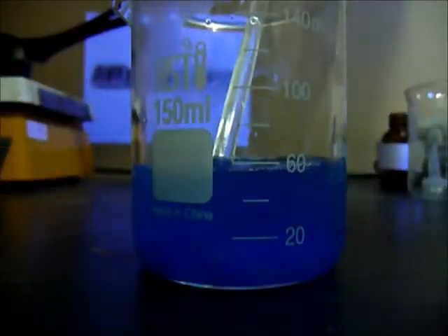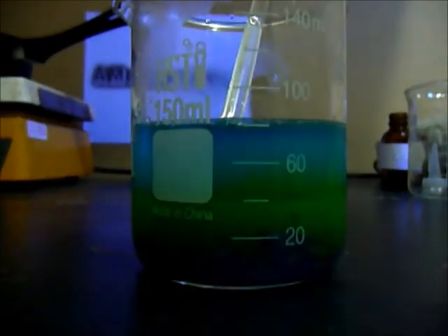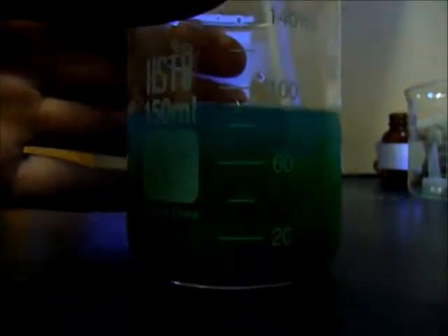Okay, that's about it. And then add the sodium chloride to the solution, and you can see that it turns green, which is an equilibrium that is copper chloride.